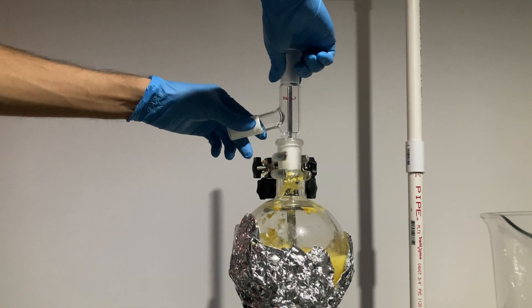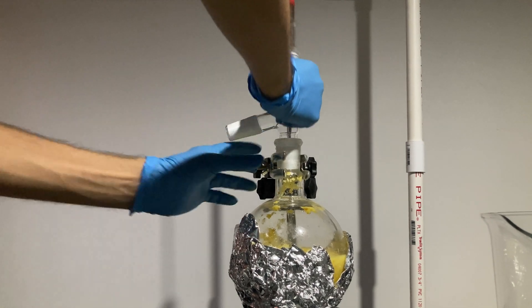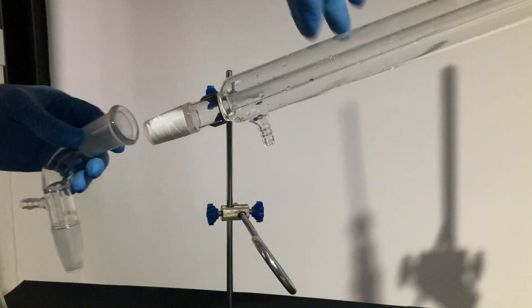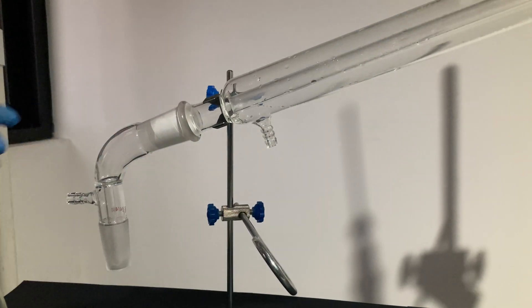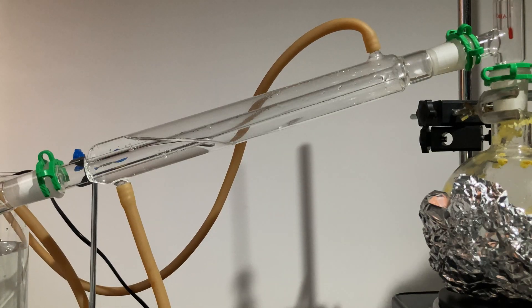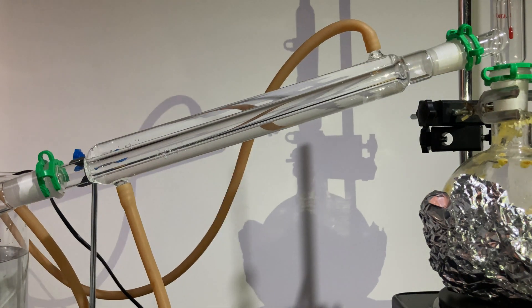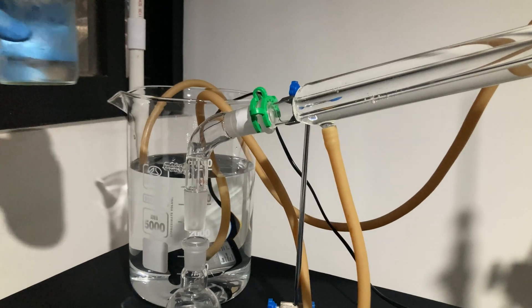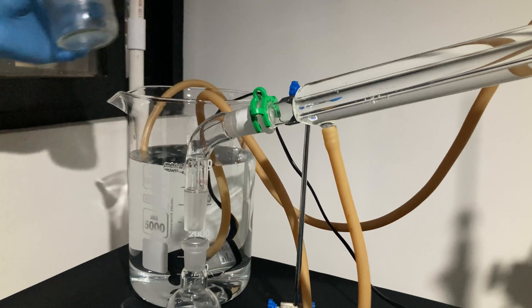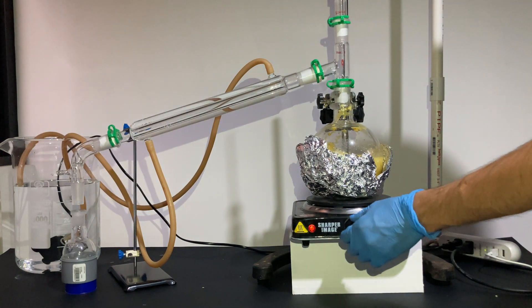When I finished transferring the mixture, I was ready to set up the distillation apparatus. I connected the adapter to the boiling flask, as well as the thermometer and the condenser. I like to put Teflon tape on the joints to avoid any leaks. Finally, I connected the adapter and put a clip on every joint to better secure the equipment. It is advisable to start cooling before heating when distilling a mixture, for safety reasons.